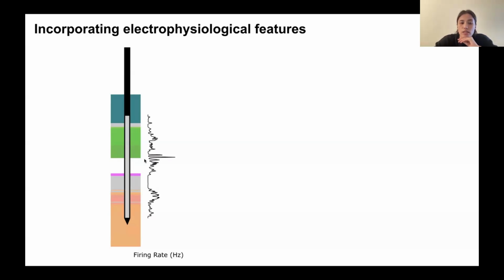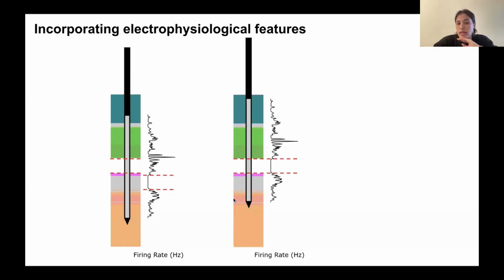And if we inspect the histology, we can see that we have this white area here, and this corresponds to an air gap in the brain. So what we want to do is basically use reference lines that we can add on both the histology and also the electrophysiology, and use these to shift the location of our electrodes in the brain such that the histology landmarks match our electrophysiology landmarks. So you can see here in this example, we've shifted the location of our electrodes up in the brain.